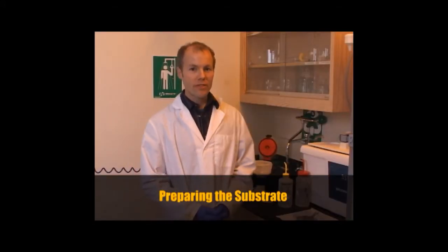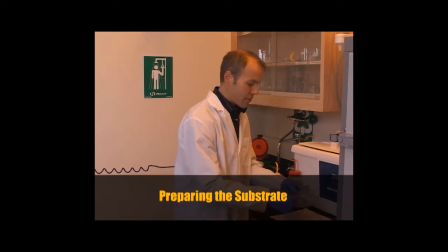The first step in EBL training is to learn the software. Generate a design CAD file for the pattern that you want, and then a run file for the exposure conditions that you want. That can be done on your own computer once you've installed the software. The second step is to come in and prepare the substrate. Once the substrate is ready, you can book some SEM time, come in and actually do the writing on the machine.